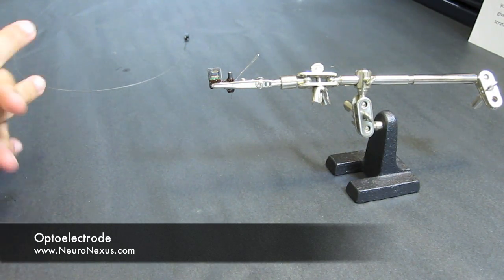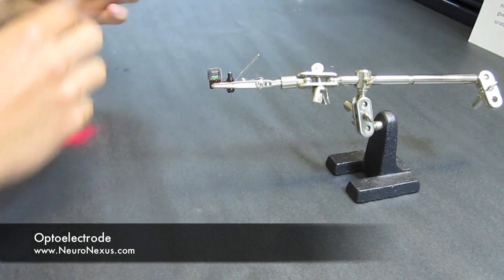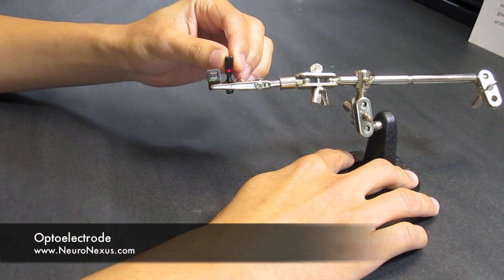Now the last thing we want to point out is the connection and disconnection. To connect, simply align the latch and snap it in.